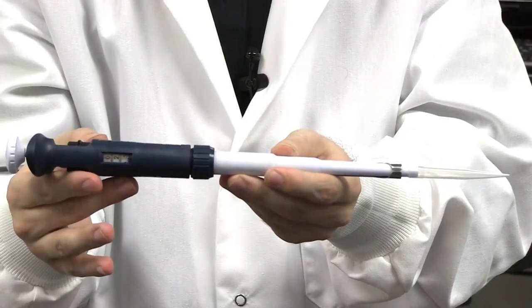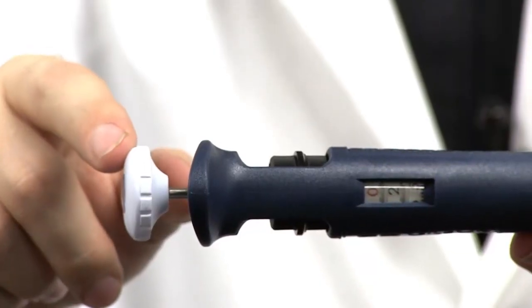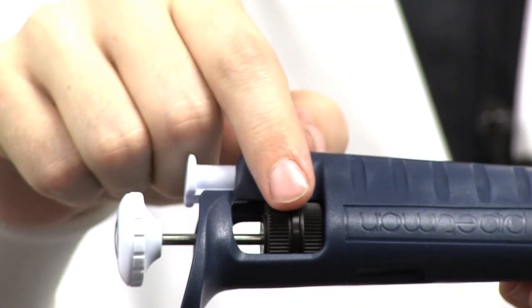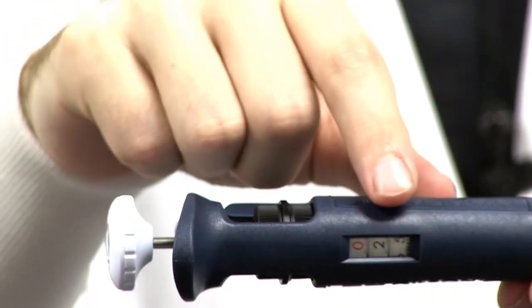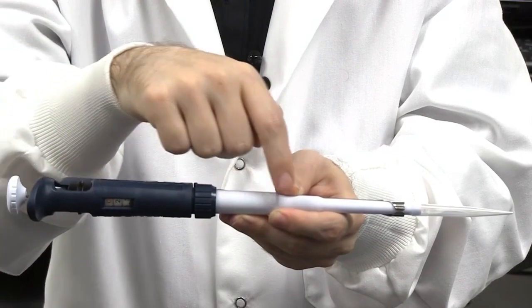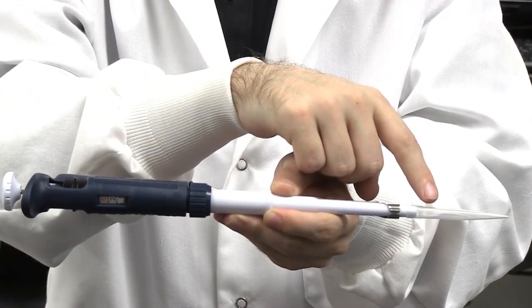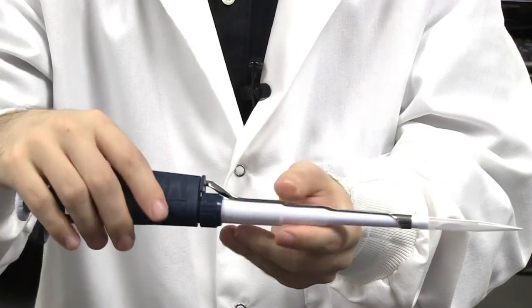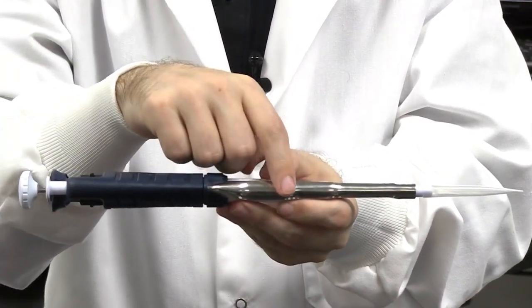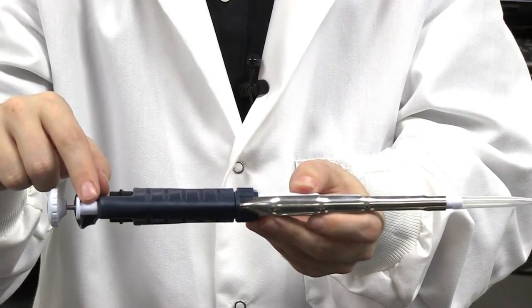The parts of the micropipetter include the plunger, the volume adjustment knob, the volume indicator, a plastic shaft, a tip to hold and dispense liquids, the tip ejector arm, and the tip ejector button.